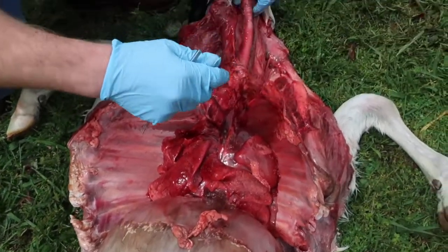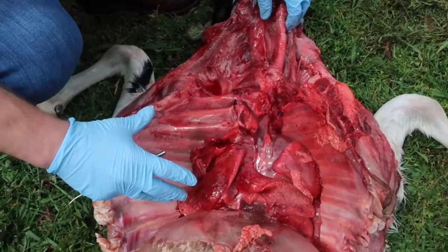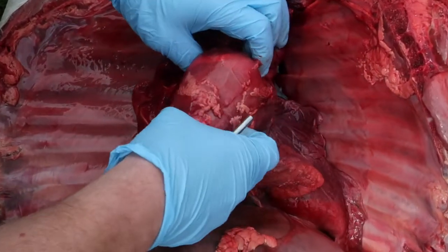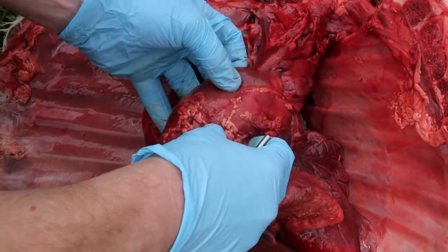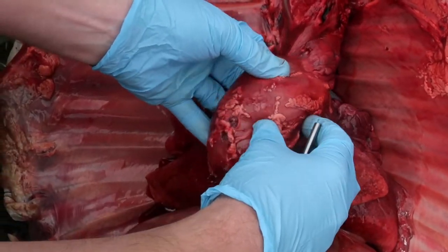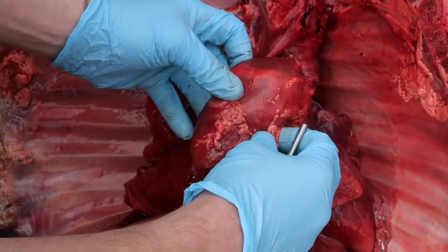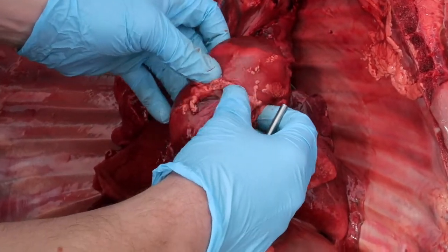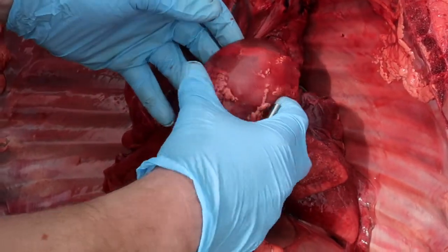Okay, so what I also want to show you here is that when I've opened up the rib cage here and exposed the thoracic cavity, as you can see this is actually the heart here. And the heart is maintained in what's called a pericardial space or pericardial sac. And that pericardial sac has a little bit of fluid on the inside, and it will allow the heart to beat and contract and move inside there with a little bit of fluid to help reduce the friction as the heart is beating. So what you're actually seeing there is that pericardial sac over the top of the heart. And I'll move this in a moment so you can actually see the heart.